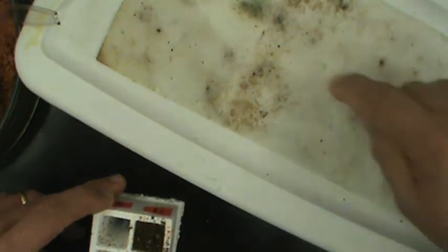This is a water box that has a reservoir of water down below and then a felt cloth that will wick the water up to the top.